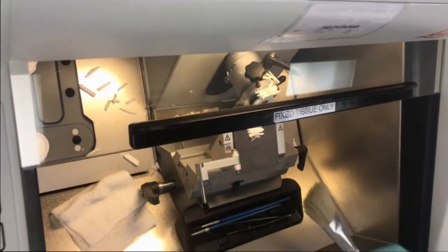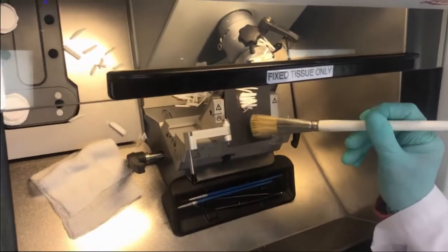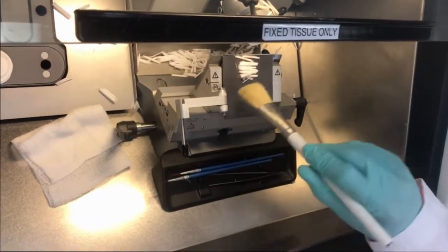There, we've got a complete face section here. Okay, now after you have it trimmed down to where you want it, take the section, you lock your wheel, and you want to clean the debris away from the platform where the section lays on the platform.